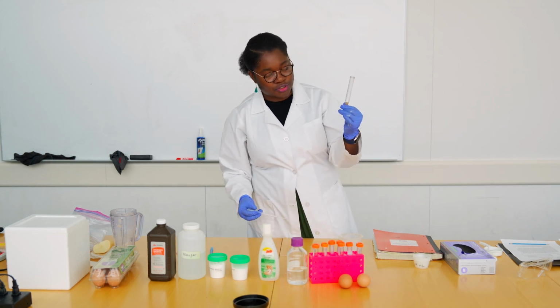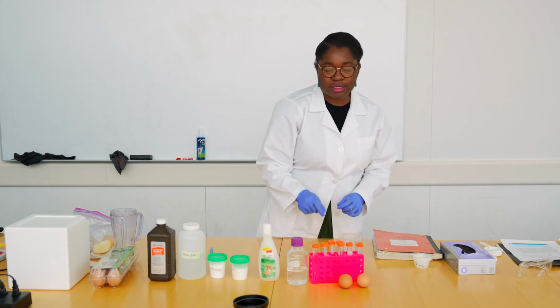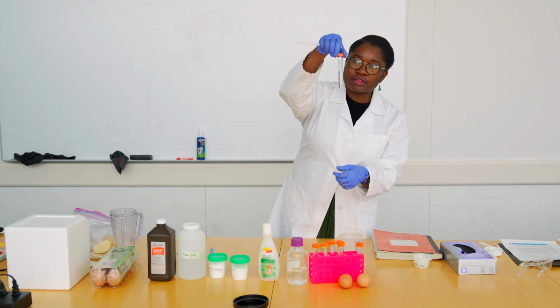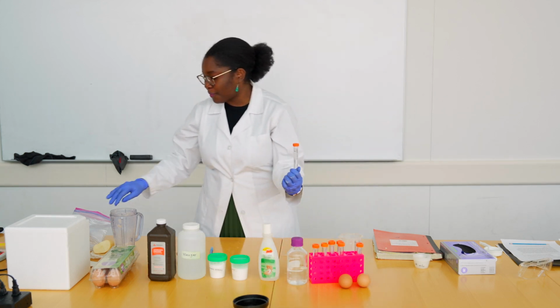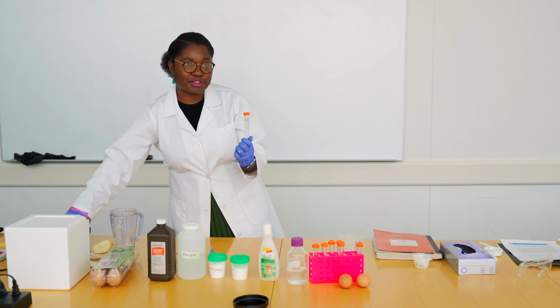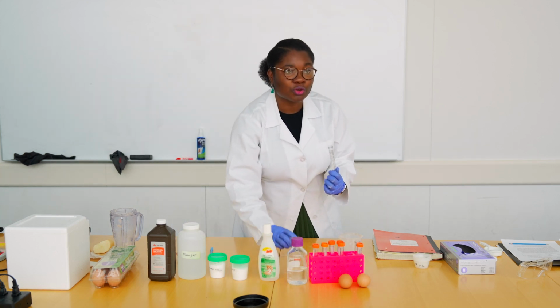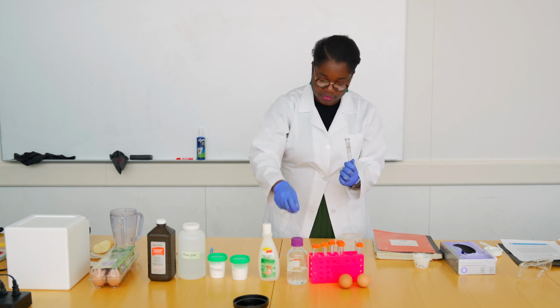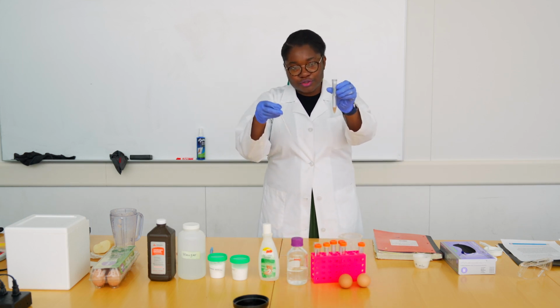So I put the juice in here. And the first thing that I want to do is look at the catalase activity. One way of doing that is by using hydrogen peroxide. So you will take some hydrogen peroxide that is already in this labeled tube. You just need a couple drops of it. And so you can avoid cross-contamination, I encourage you to use a different pipette. That's why I was saying keep everything separate so you can have total control of your reaction. So there we go. Measuring some hydrogen peroxide and keeping it there with our other tube.